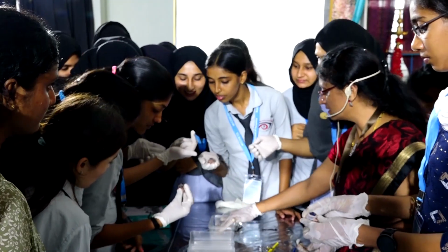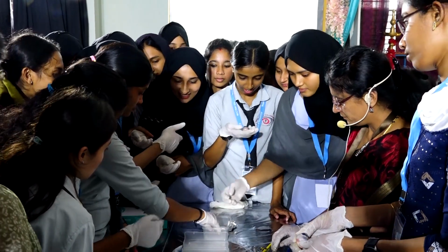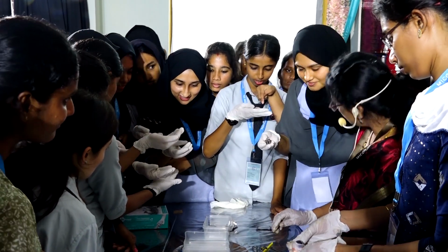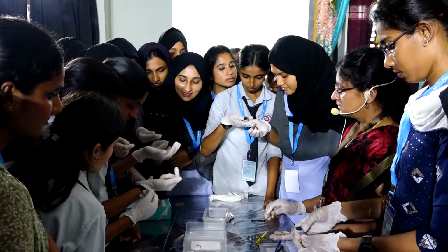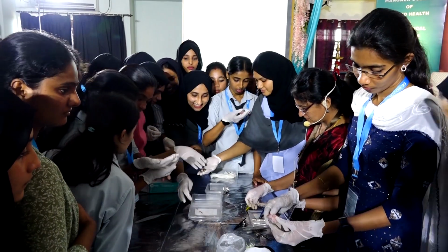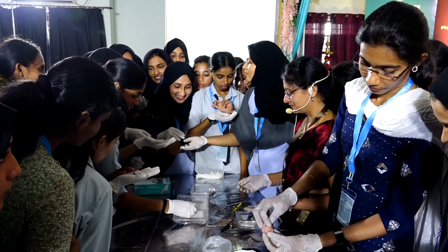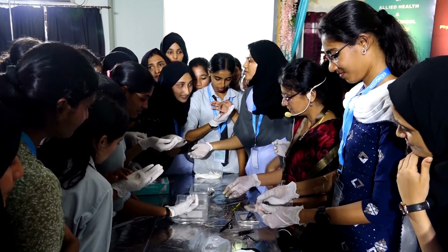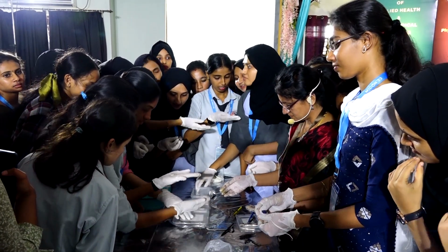Take care. Cornea. You can just wet your surface, it's getting dry. Yeah, you can see it. Session of dissection. So, who are sitting at the back or who came later, kindly wait. We will have another session. Announcement. There is another session of dissection. So whoever have come late can wait for the second session.